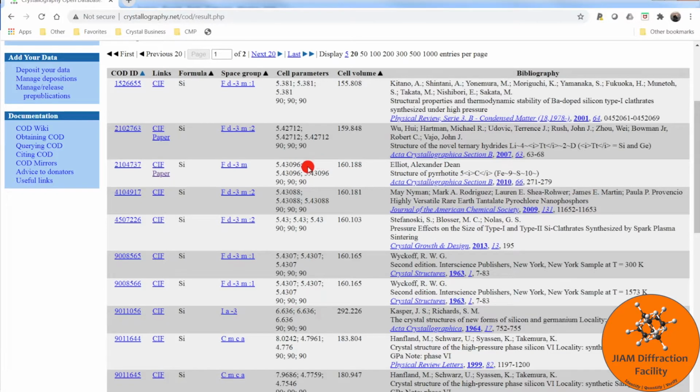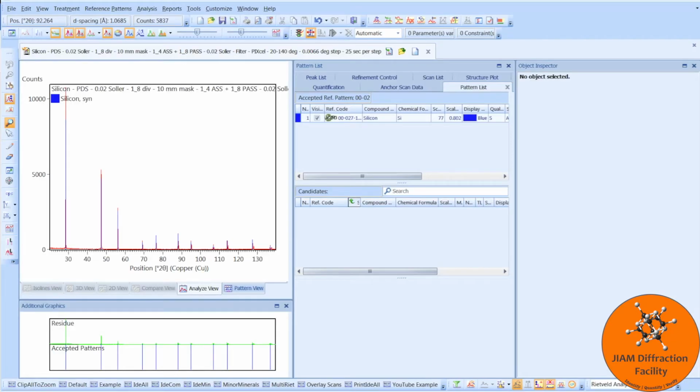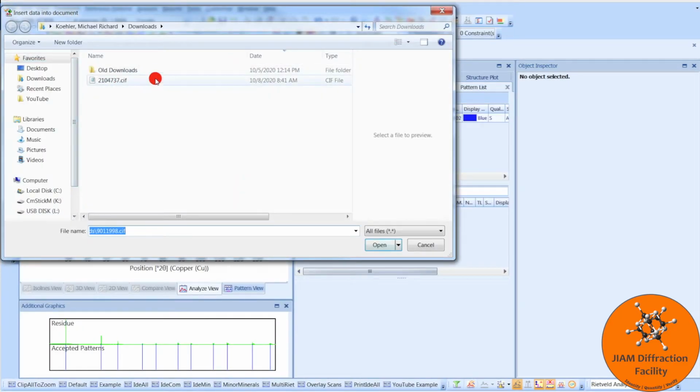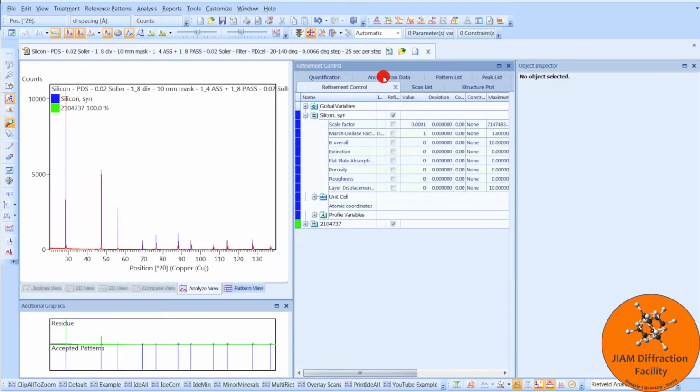Now, I know my lattice parameter for my phase is about equal to this, and it has this space group, so I will go ahead and just choose this CIF file. We see it download. I will then go back to HighScore Plus and go to File, Insert. Here we see the CIF file that we just downloaded. I will double click, go to Refinement Control, and now we see the phase here, and we see it here.